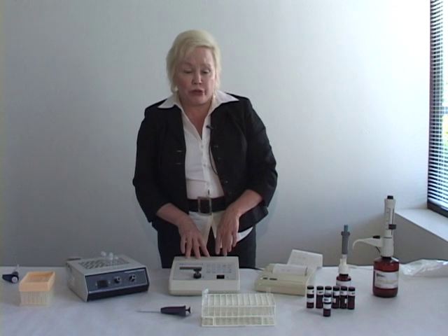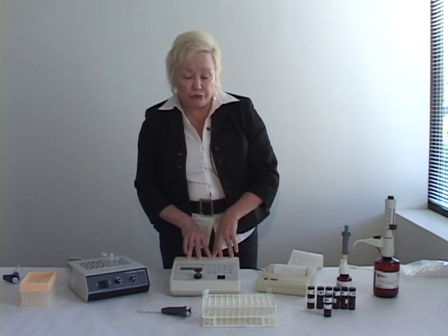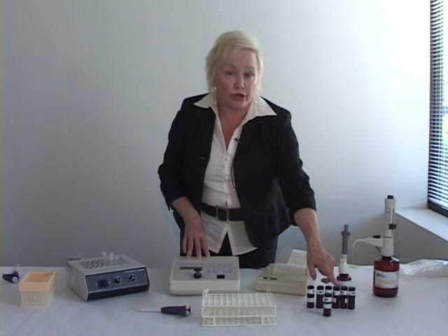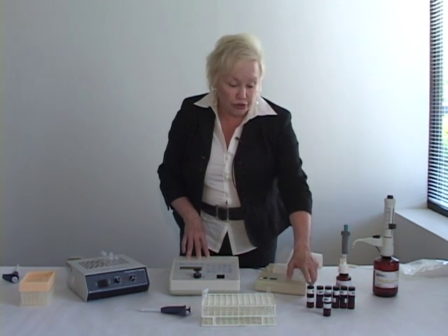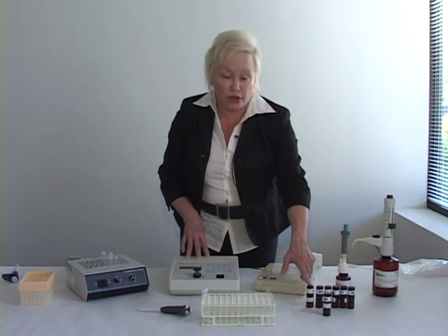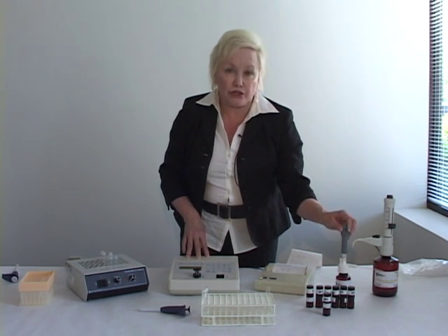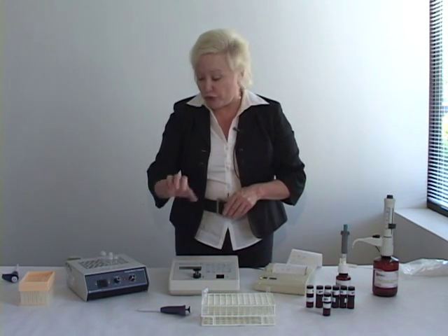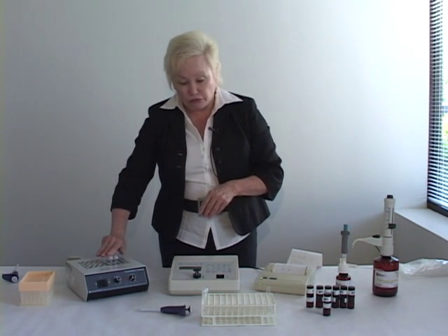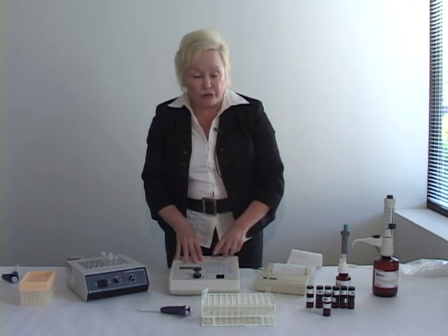In order to calibrate this instrument, what we would do is exactly what we did to run a sample. We would set up a tube for each one of our calibrators. We would transfer 25 microliters of that calibrator into a labeled tube with the same label, and we would run it just the way we did the biodiesel diluted sample. These do not require any further dilution. Once they're in the tube, we add the detector, we cap them, we invert them, and we let them heat. And then we run them on a run function instead of a stat function.